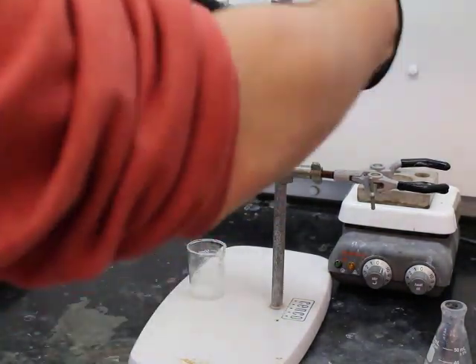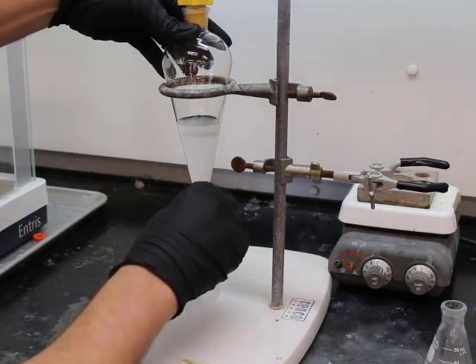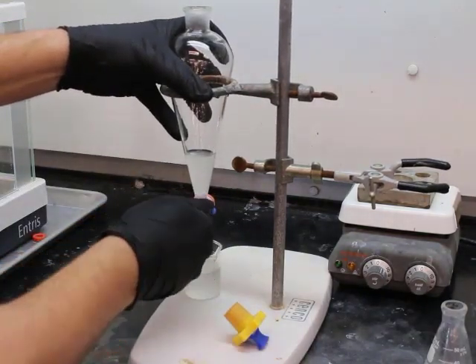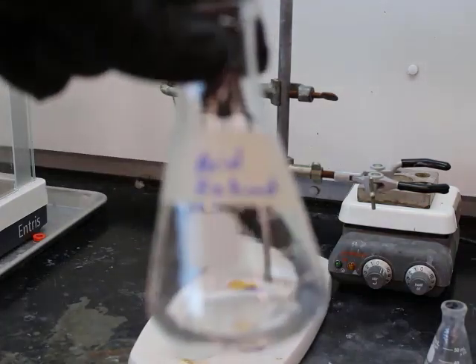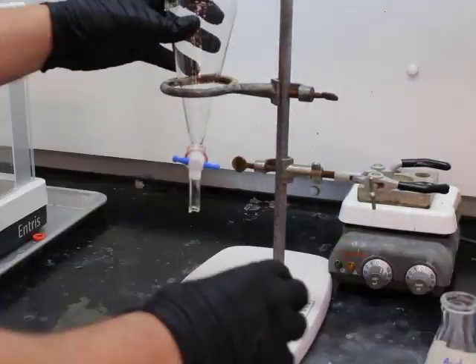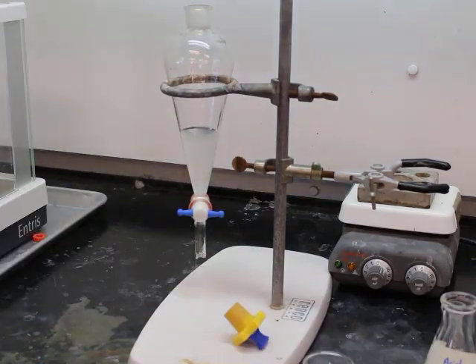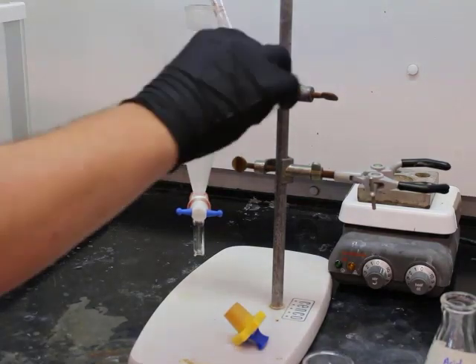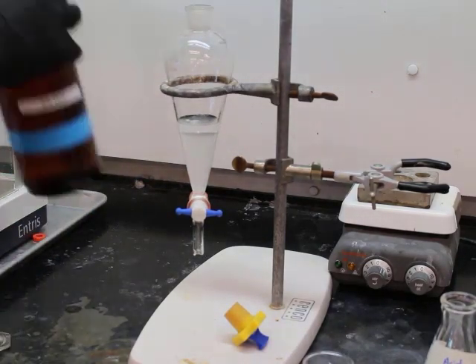Mixed it, turned on the Millennium Falcon's hyperdrive, did a super mix. One note here, you'll notice that if you ever forget to take the cap off the top of the separatory funnel, it starts to bubble, because in essence, you have a vacuum, and it doesn't want to allow the solution to drip out of the bottom of the stopcock when you turn the stopcock.